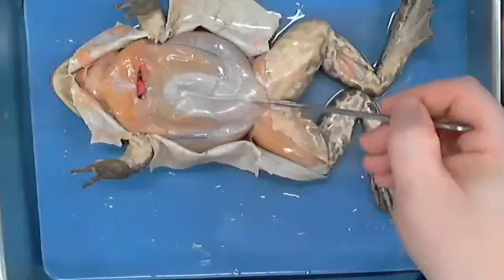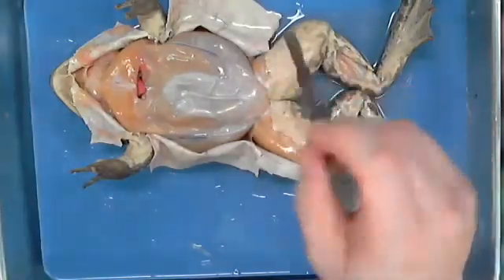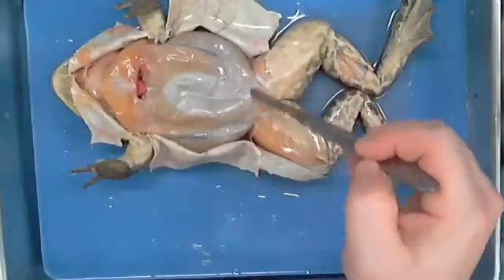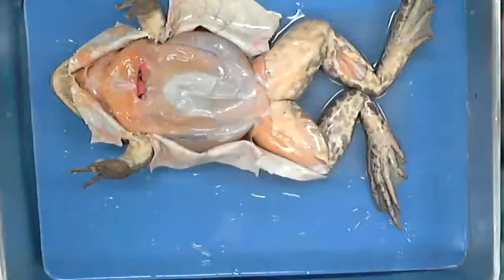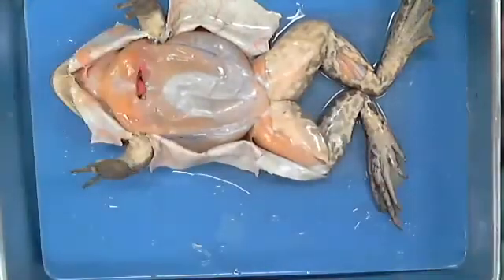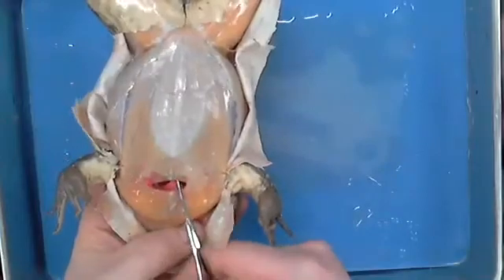Ventral. No. It's called median. Okay, so I'm going to give median incisions, and then I'm going to laterally incise to open this up, and then I'm going to cut through this bone so you have the ability to see. I'm going to do this with a pair of scissors because it's far safer, for me and probably for anything that happens to be underneath it as well.